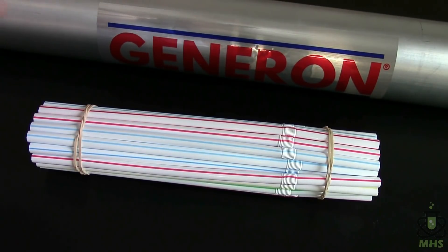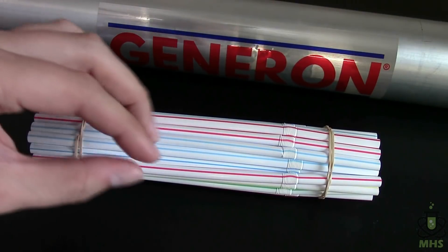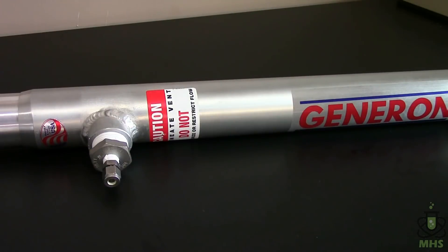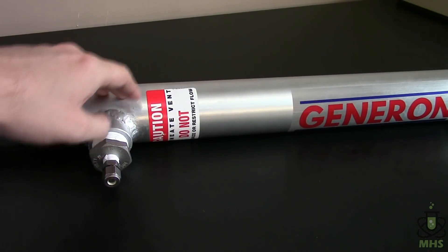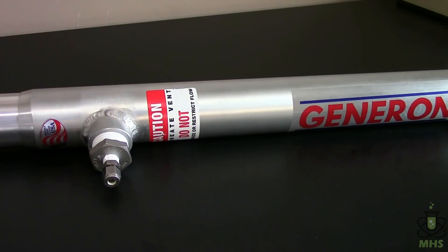These fibers go through two solid plates which you can kind of visualize as these rubber bands here so that the oxygen that permeates through them is collected in this central region. The model I have here actually has this outer casing around it and that allows me to collect that filtered oxygen through this output port on the side here. And that actually opens up a lot of other possibilities if you want to use that stream for experiments that could use enriched oxygen. And it's not pure oxygen because some nitrogen does still make it through the fibers but it is at a higher concentration than air which I hope to show later on.